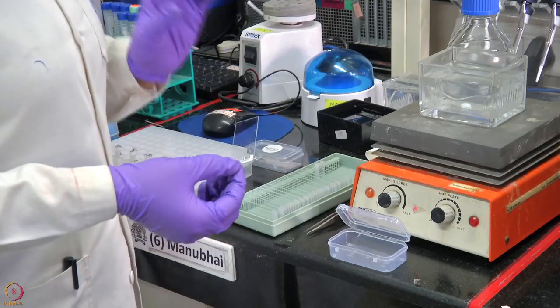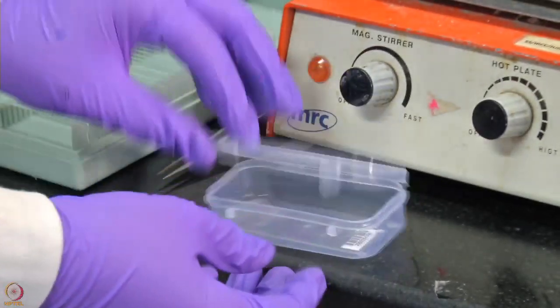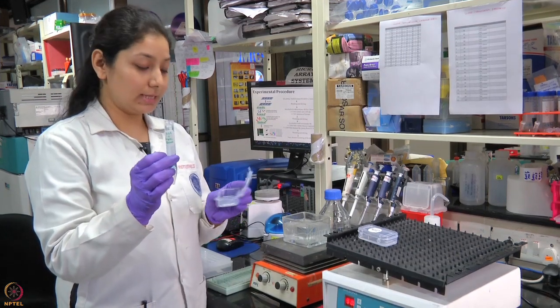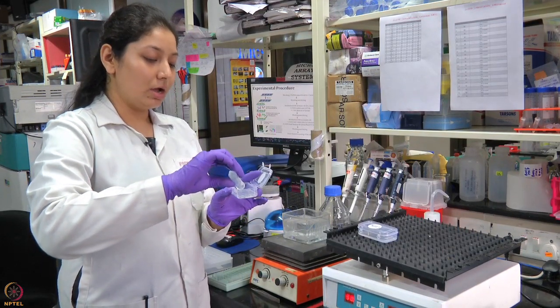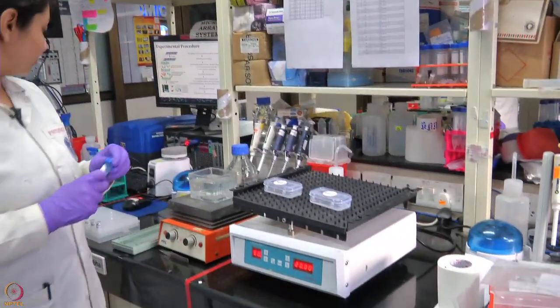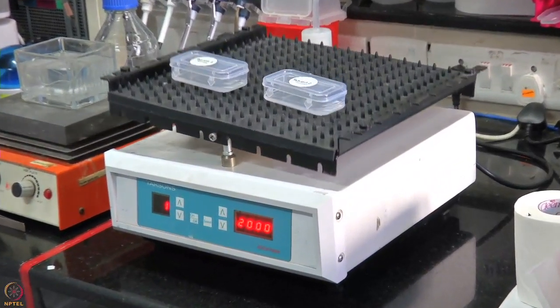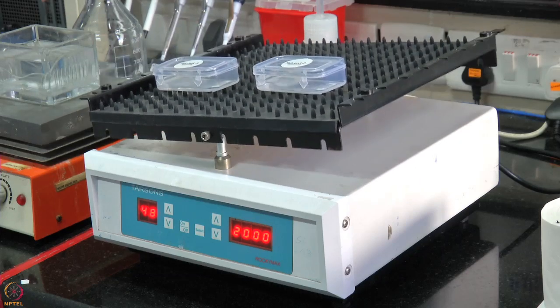This experiment shows two slides being screened together for two different patients. The first step is blocking of the slide. We use BSA and SuperBlock solution, placing it on the barcode region. The slide is kept for incubation for two hours on a rocker so that all the extra spaces except the proteins are blocked properly. Speed is kept such that the slide is covered properly with the blocking solution.